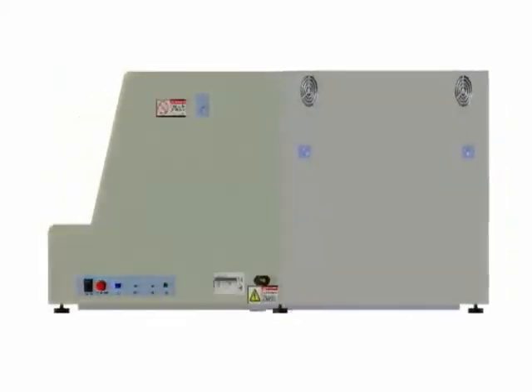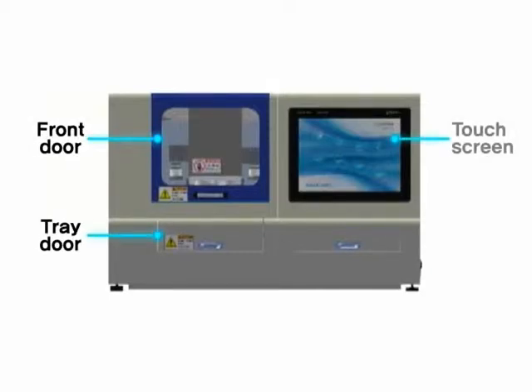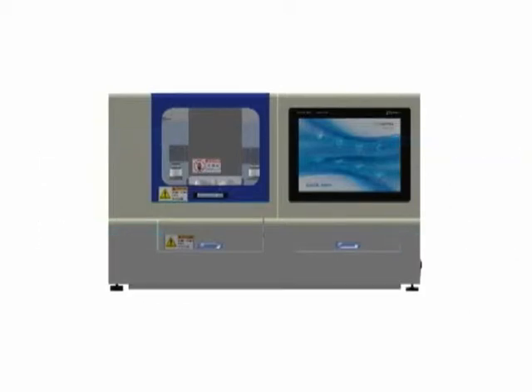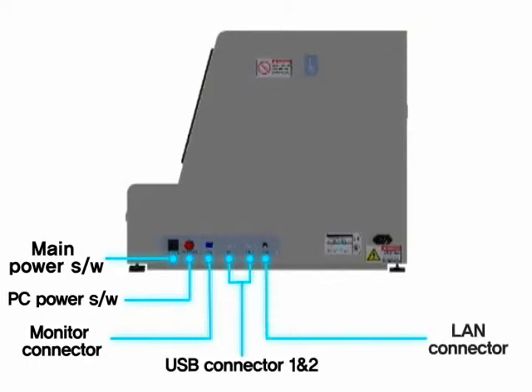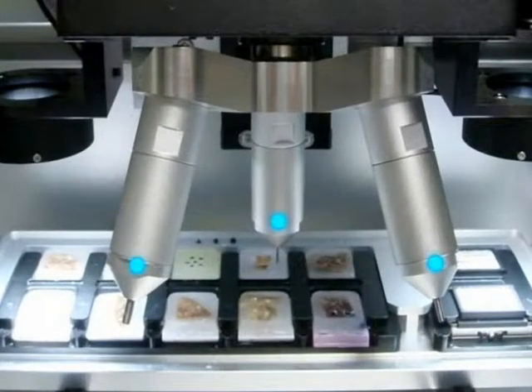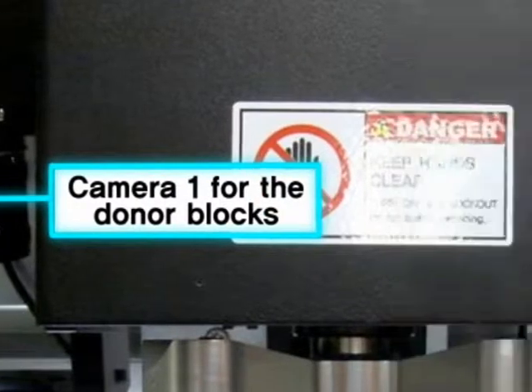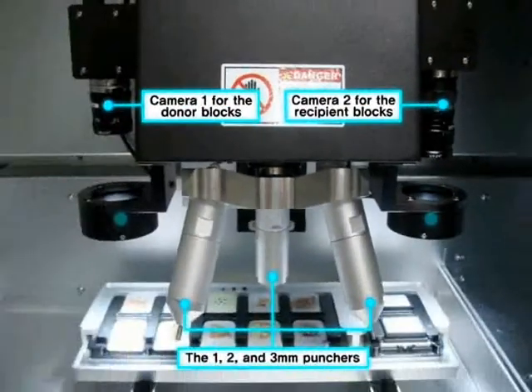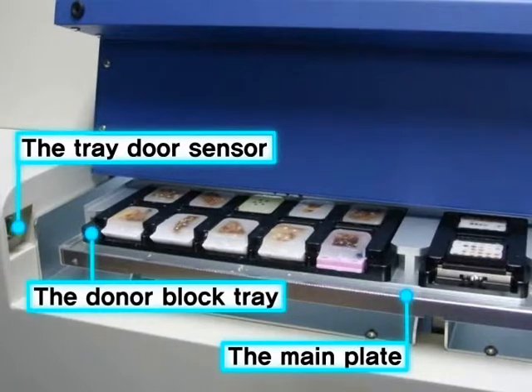Let me introduce the names and images of this instrument. On the front side are the front door, tray door, touchscreen, and drawer for the keyboard. On the right side are the main power switch, PC power switch, monitor connector, USB connectors, LAN connector, nameplate, and AC power input part. In the instrument are the puncher module, the 1, 2, and 3 mm punchers, camera 1 for the donor blocks, camera 2 for the recipient blocks, LED lighting, the front door sensor, the tray door sensor, the main plate, the donor block tray, and the recipient block tray.